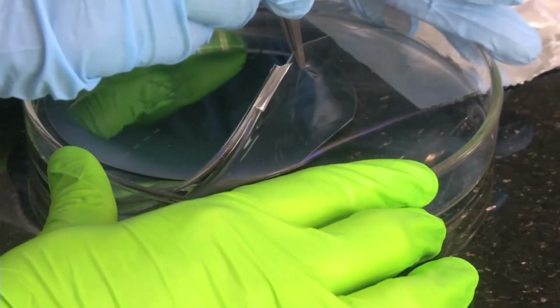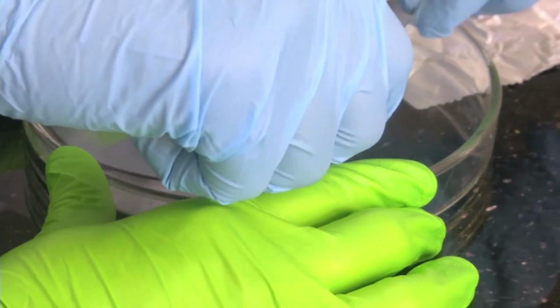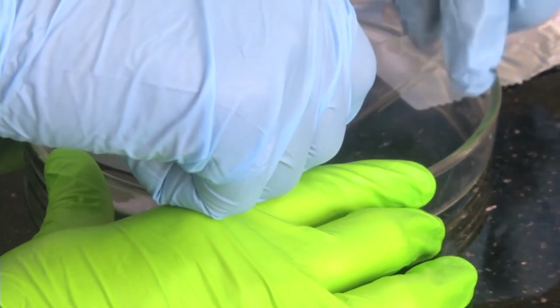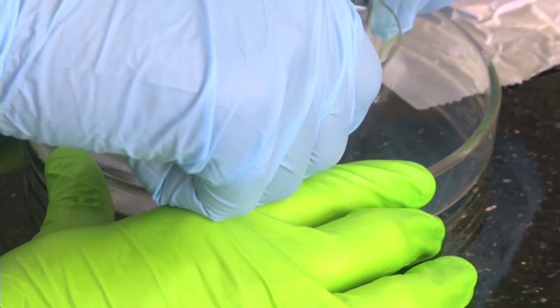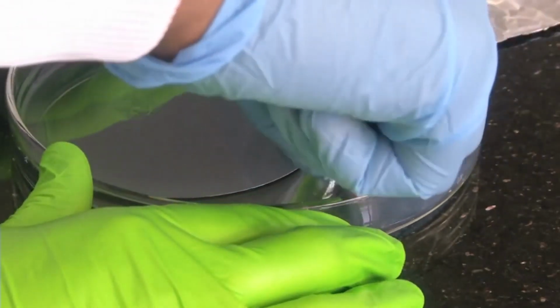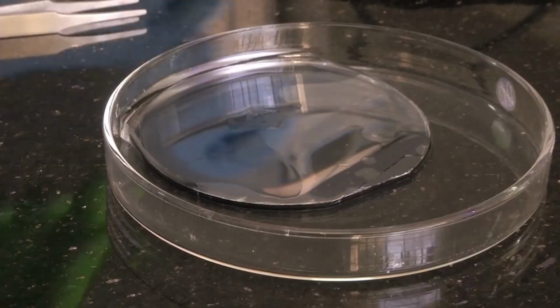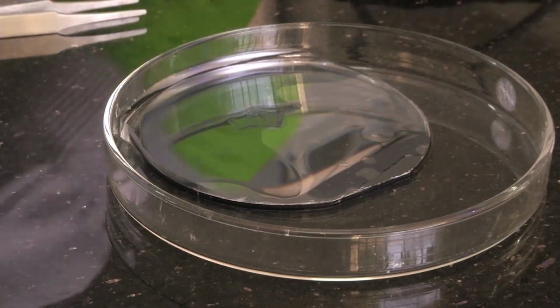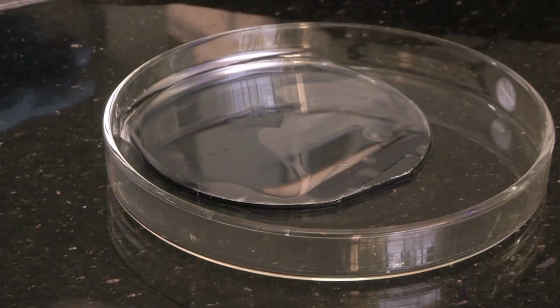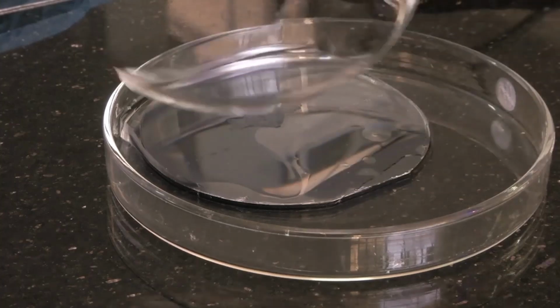We have to be very careful around the mold, because the mold will get stuck onto the bottom of the dish. So till the mold we will take out, and then try to see how we can take out the PDMS around the mold separately. So we have removed PDMS from around the wafer. So this is how the PDMS after curing looks like. This is a PDMS that was formed around the silicon mold.